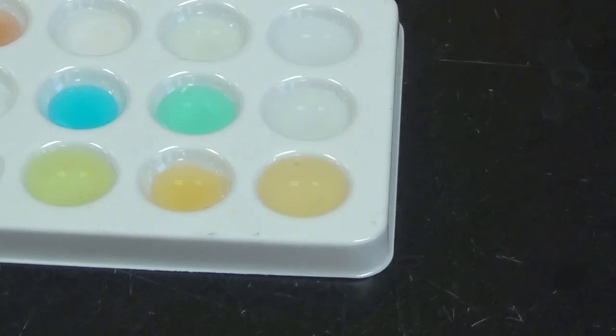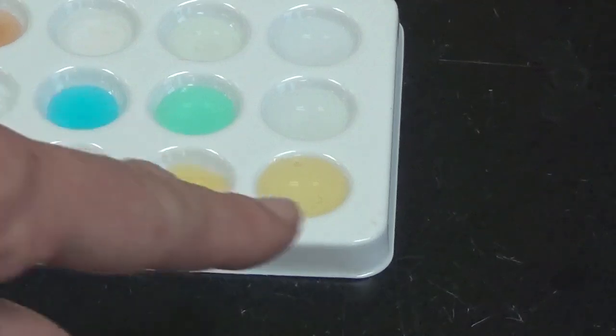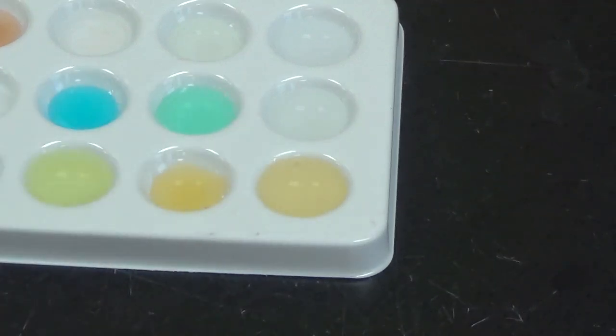Hopefully you were recording all of that information into your reaction grid as we were going. If not, you're going to have to go back and watch it again and record all that information. And then when you are done with that, you are going to have to answer the analysis and conclusion questions, numbers 1 and 2. For number 1, you are writing 2 chemical formulas for what is now in these trays if there was a chemical reaction there.